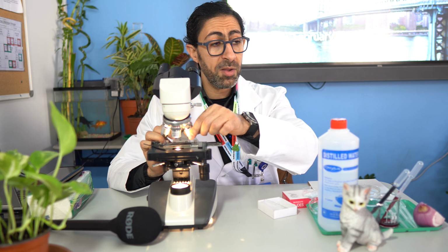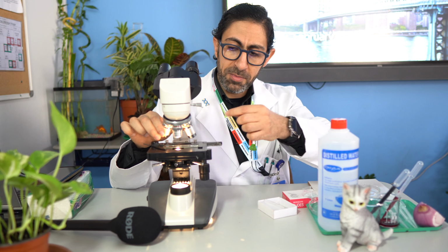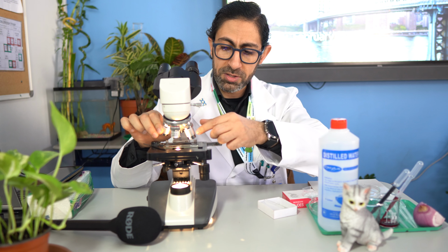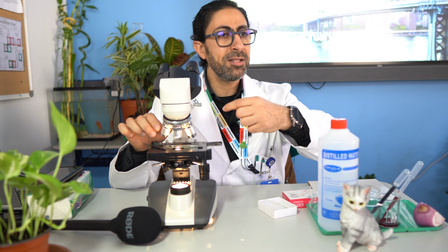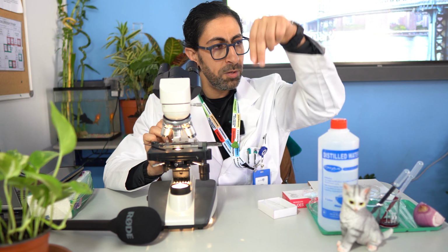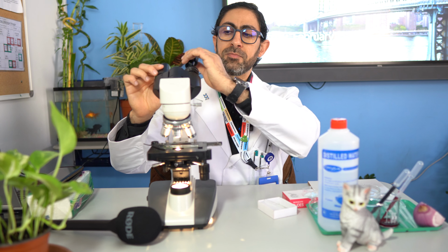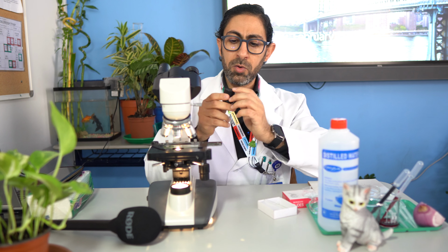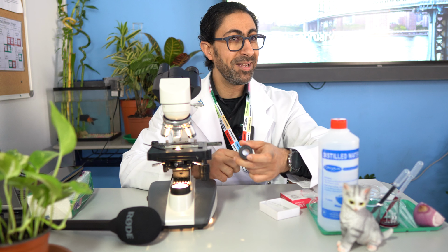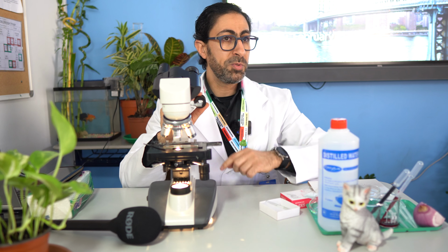Each one of them has a specific magnification power written on it. To adjust it firmly, there is a tick sound you have to listen for while you are doing this. If you focus, the tick sound indicates that you properly chose the correct lens, and the lens is perfectly over the specimen. After that, we have the eye lens, where you have to look at the magnification power written on it in order to calculate the total magnification power properly, by multiplying the power written here by the power written on the objective lens.